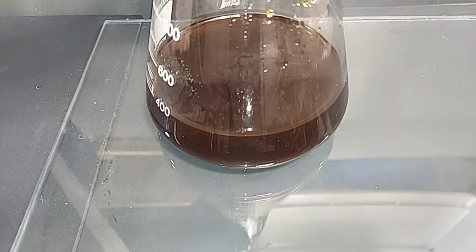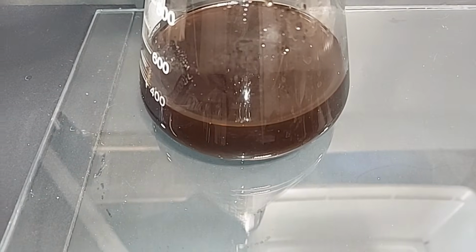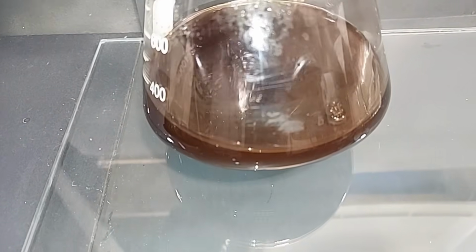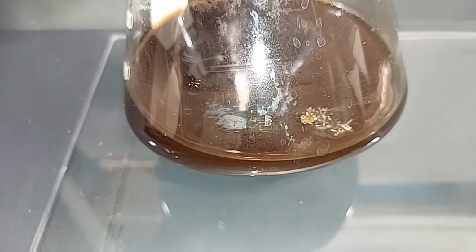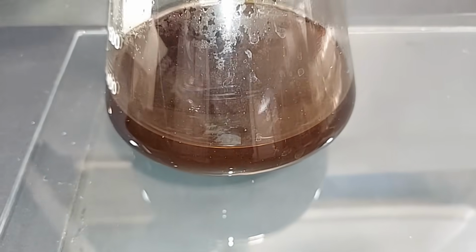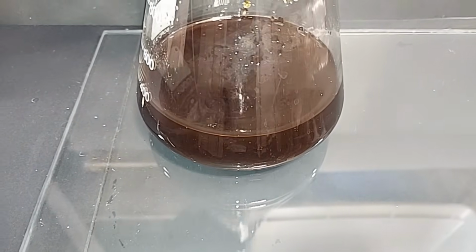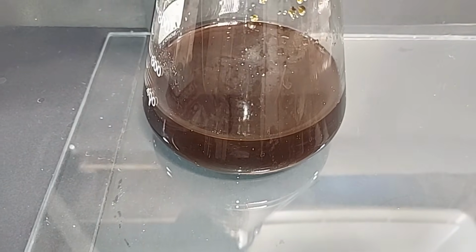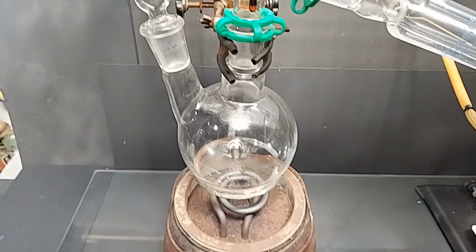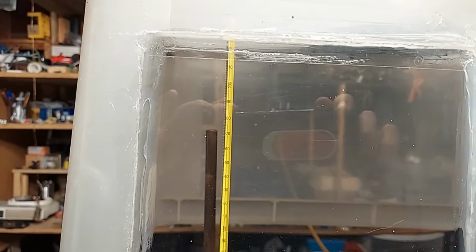Nice. I didn't get to the distillation last night, so this ended up sitting overnight, and if you tilt this just a little bit, you should be able to see up there some crystallization. That is most likely just unreacted ferrous sulfate, no problem, of course, but I'm going to decant off the top, leave the crystals on the bottom, and get the distillation set up. All done. Just a simple distillation setup. I'm sure you've seen this dozens of times. This is my homemade fume hood right there.